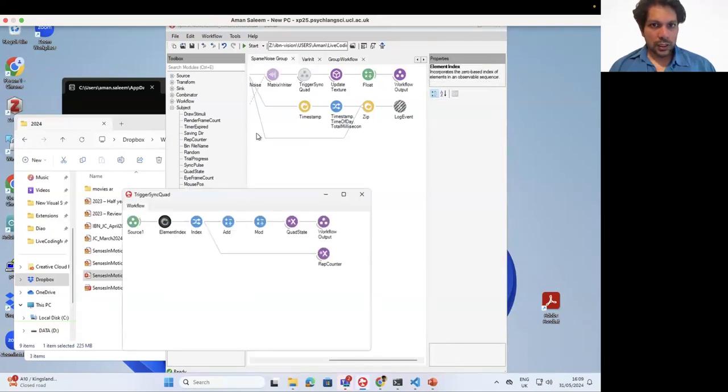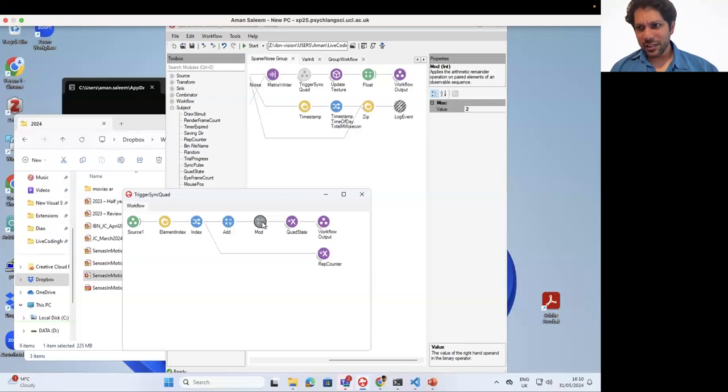So what this is doing is every time the stimulus is being presented, we take the index of that stimulus, and then we add 1 and we divide by 2. So every time the index of the element is even, you get a quad state going from 0 to 1. When it's even, it's white. When it's odd, it's black. So every time a new stimulus comes, it's just flipping between 0 and 1.